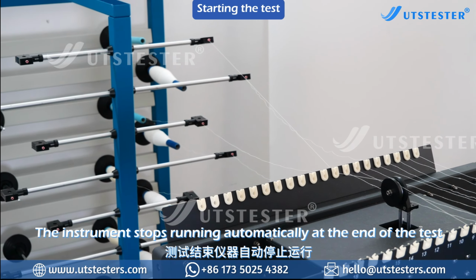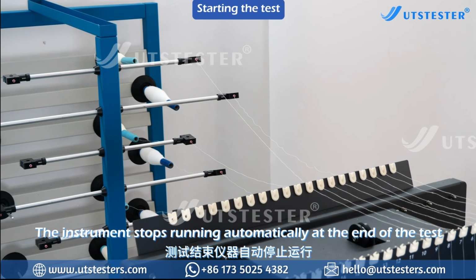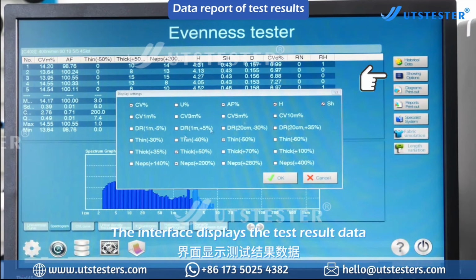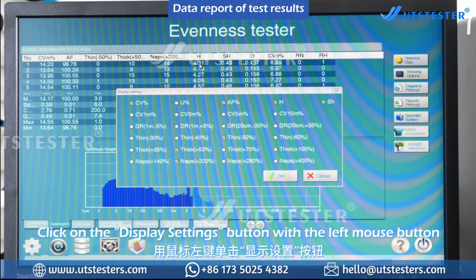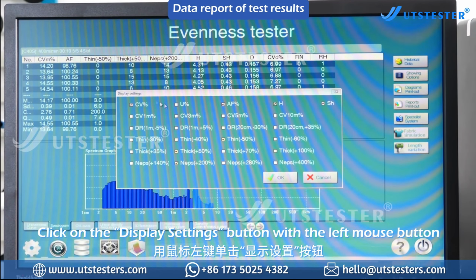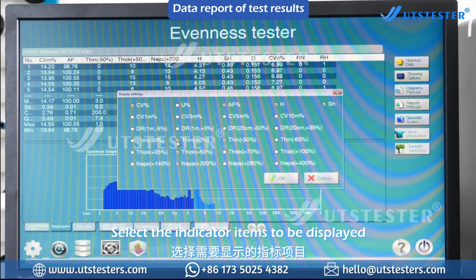The instrument stops running automatically at the end of the test. The interface displays the test result data. Click on the Display Settings button with the left mouse button. Select the indicator items to be displayed.